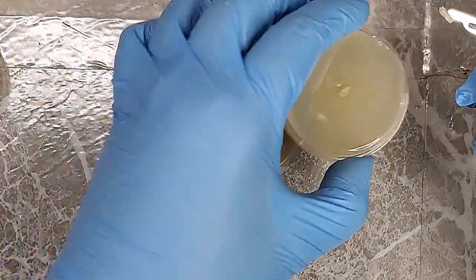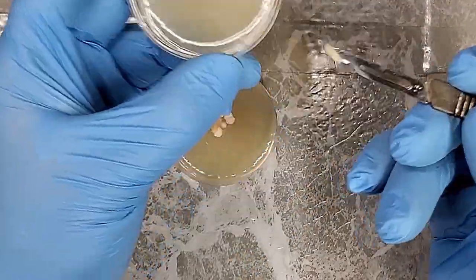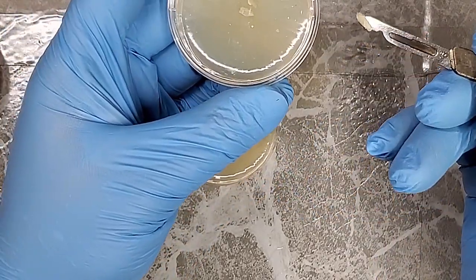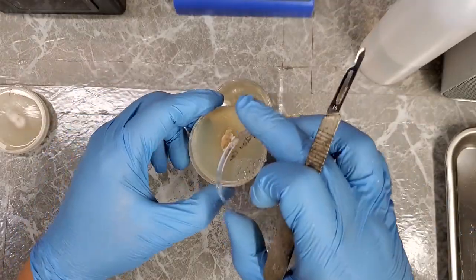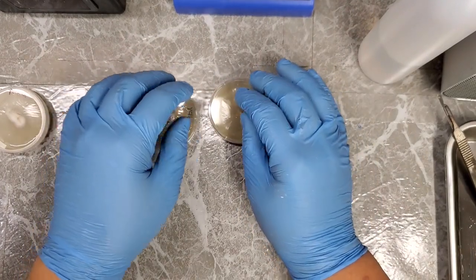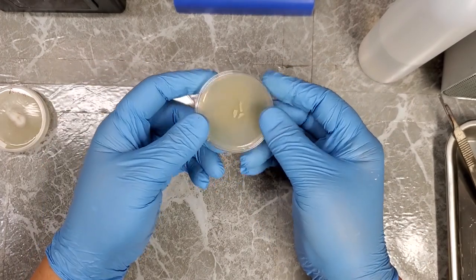And then pretend that this is a completely empty, sterile Petri dish that has nothing on it. Just ignore those two chunks in there. And then, like I said, you're doing this as fast as possible, usually. So once you get your small sample that looks clean, put it on here and close it. Let me close this up so I don't poke it again. The first few days while I am incubating my Petri dishes, I like to let them stay unwrapped. So I'll put them in my incubator just like this for a few days.